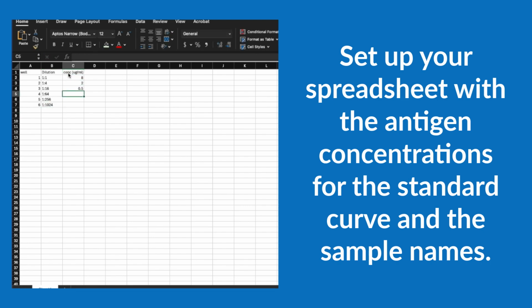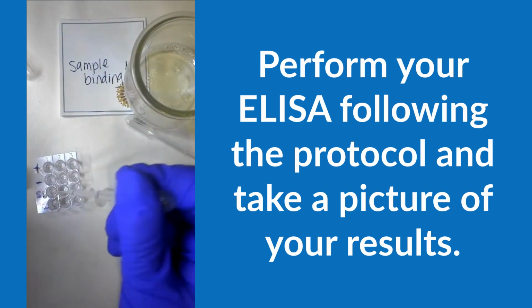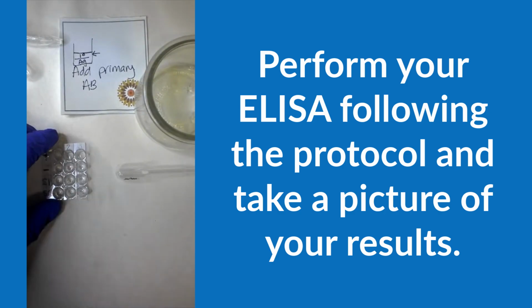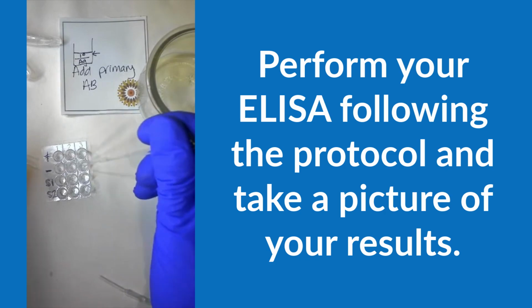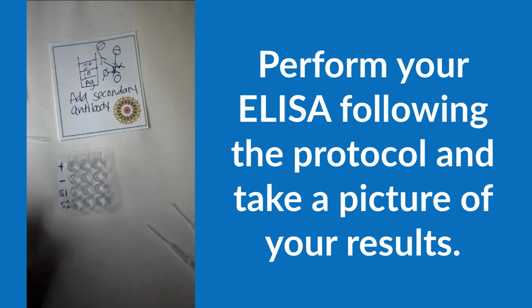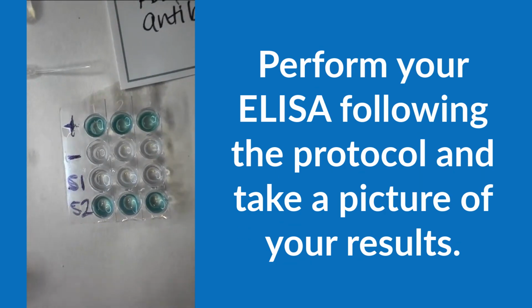Set up your spreadsheet with the concentrations for the standard curve and the sample names for ease in recording data later on. Perform your ELISA following the protocol included with the kit. You should have experimental samples, control samples, and a standard curve. After incubation, take clear, shadow-free pictures of your results and save them as JPEGs.